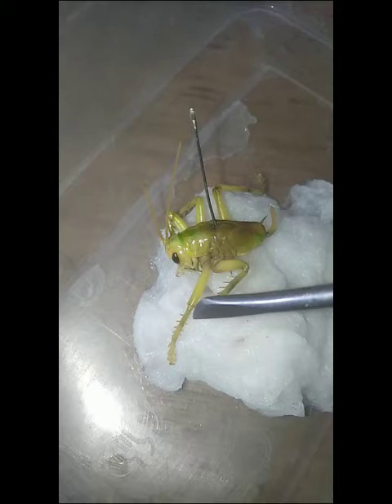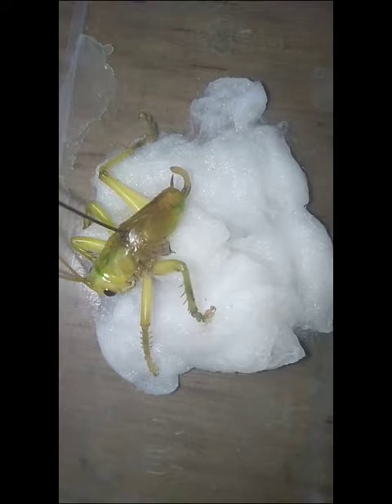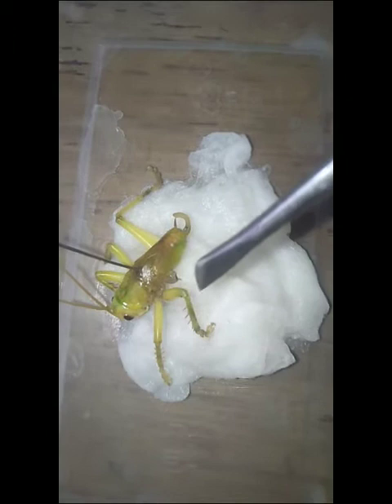There is a pair of large compound eyes — this is one eye, and this is the other eye. It also includes the mouth. Surrounding the mouth opening there are some mouth appendages. The thorax has three pairs of segmented legs: the first pair, the second pair, and the third pair.